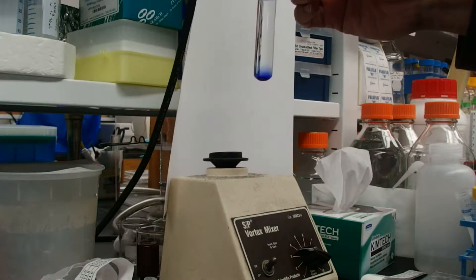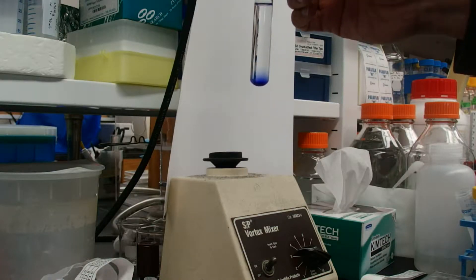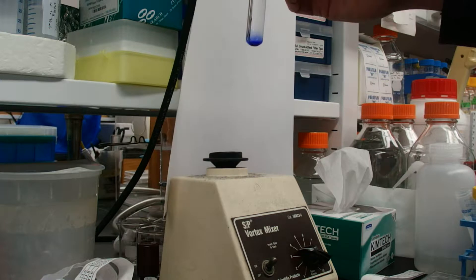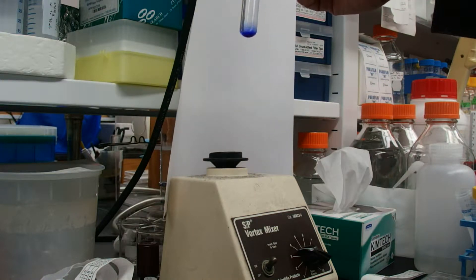Thorough mixing is essential for any solution chemistry to work properly. As you can see here, I've added dye to the bottom of this water that is a dark blue or purplish color.